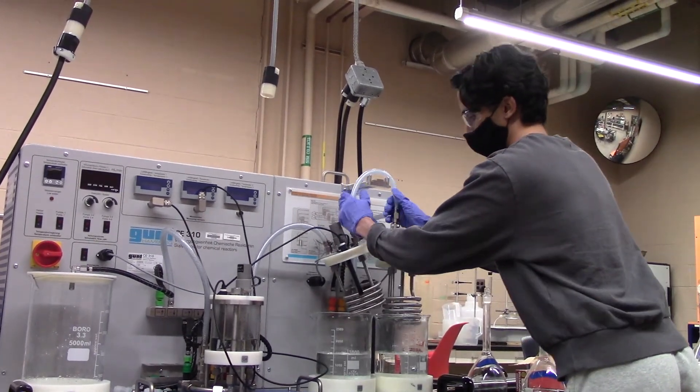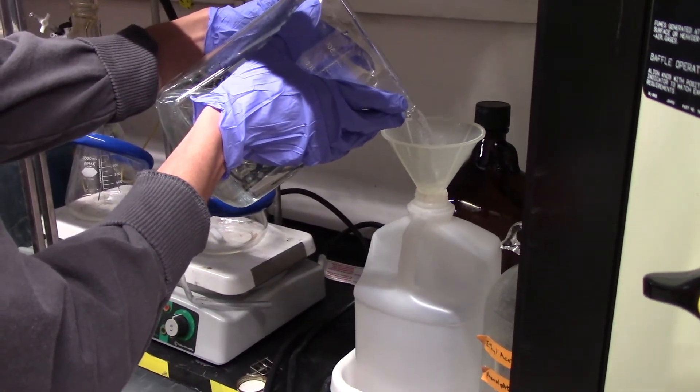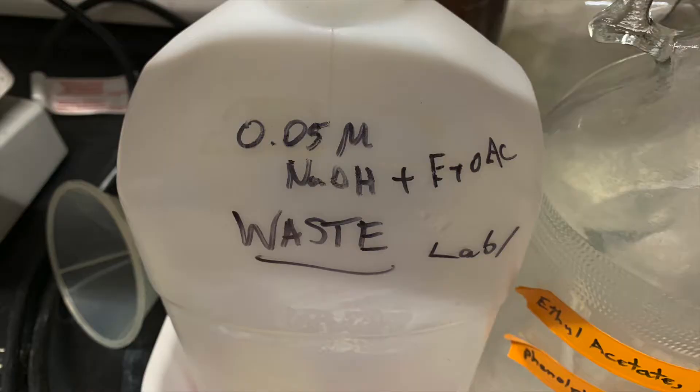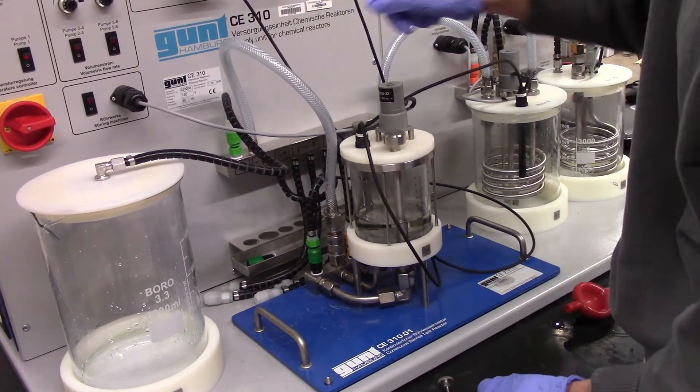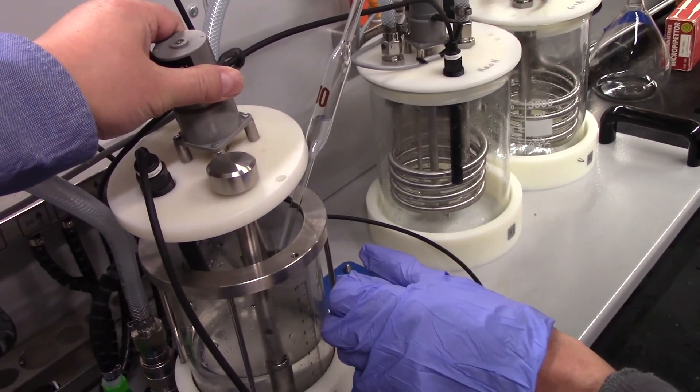Properly dispose the remaining solutions into the designated waste container for this experiment. Finally, pipet out any remaining product out of the collection vessel and dispose it into the same waste container as before.